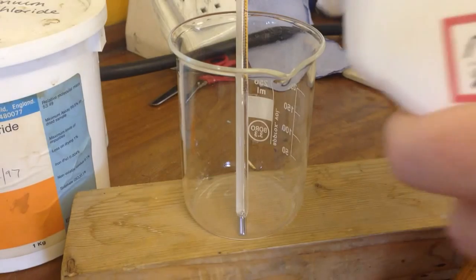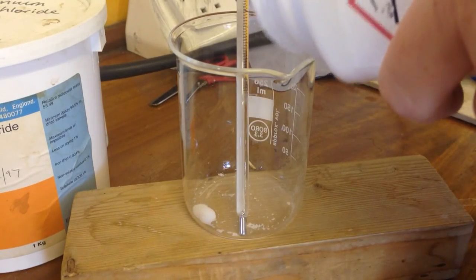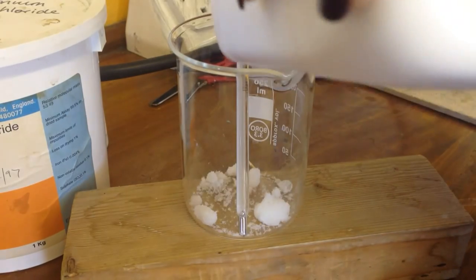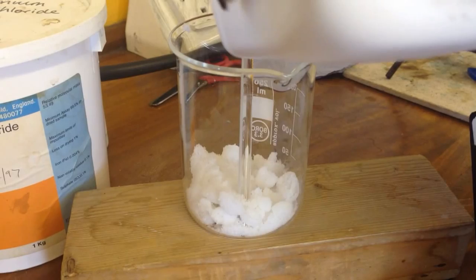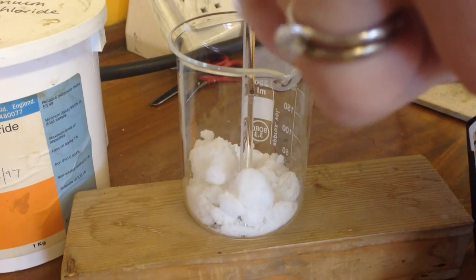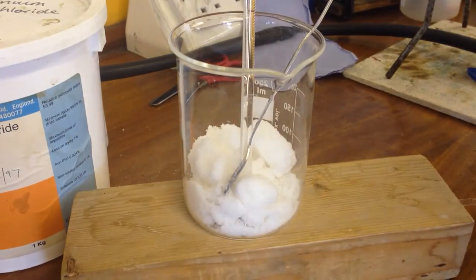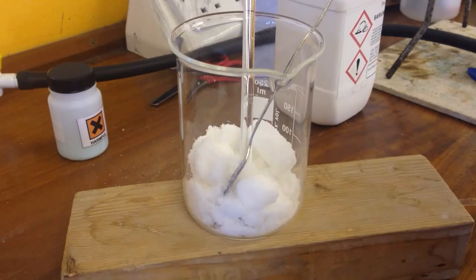And I love this experiment because this is basically what we call bucket chemistry. So you just chuck a load of stuff in a beaker. So I'm going to put my barium hydroxide in there. Nice. And then I need to get some ammonium chloride in there.